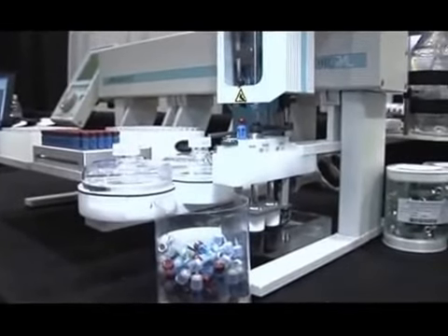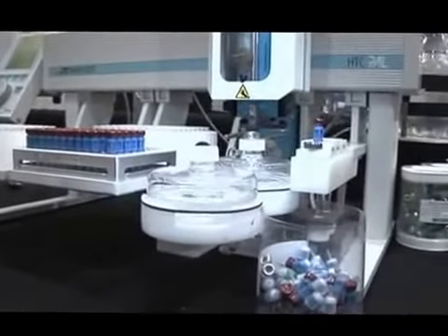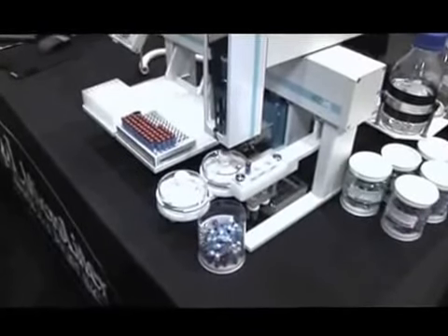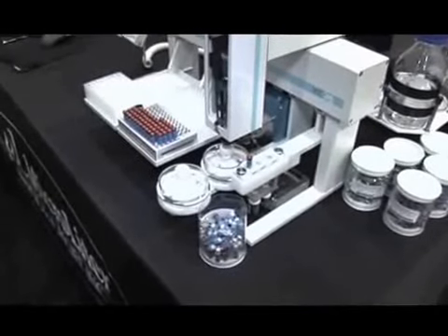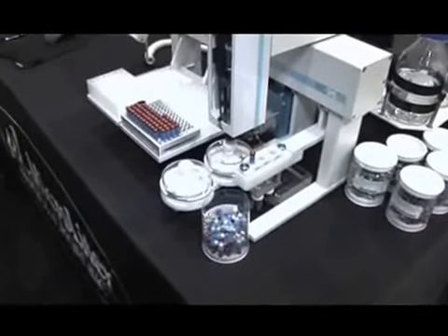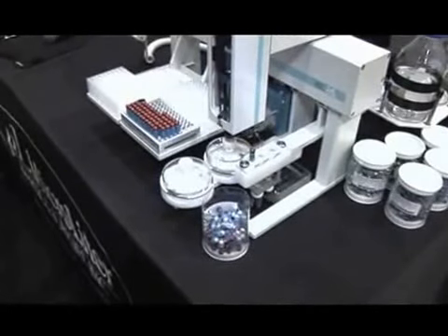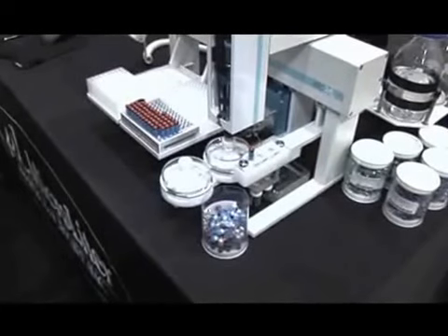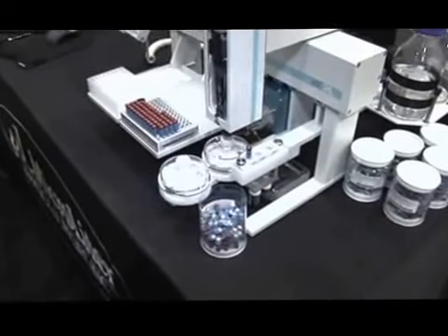ITSP is extremely useful for methods that are required just in time. You can do a variety of methods. It's controlled by the PAL software, and then we integrate that into your system as well. We will help you by providing you with raw devices that you can do manually, and then we will write the automation and come to your lab to show you the demo, and you can actually run samples during the demo to replicate your manual method that we've transferred.